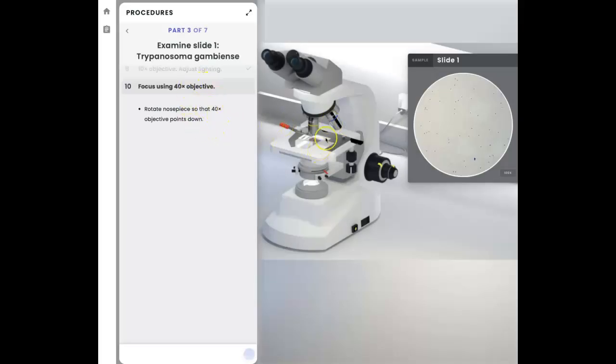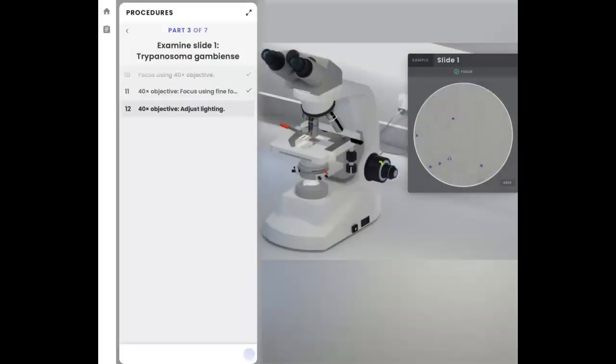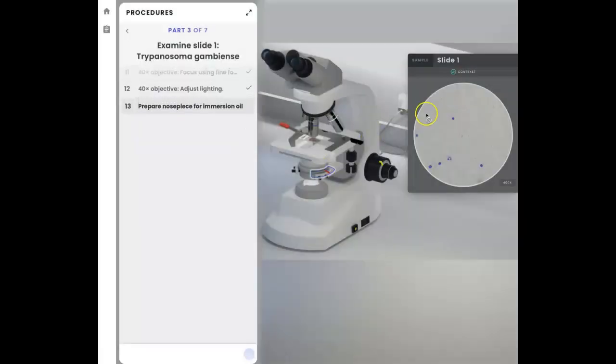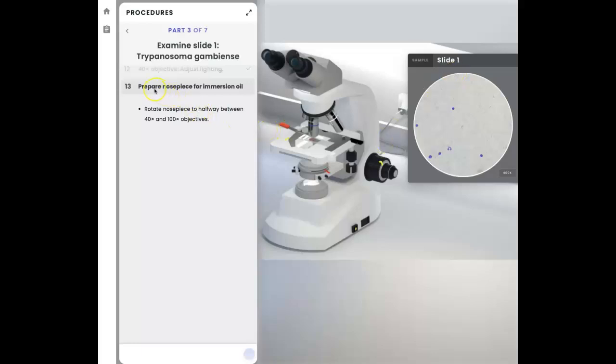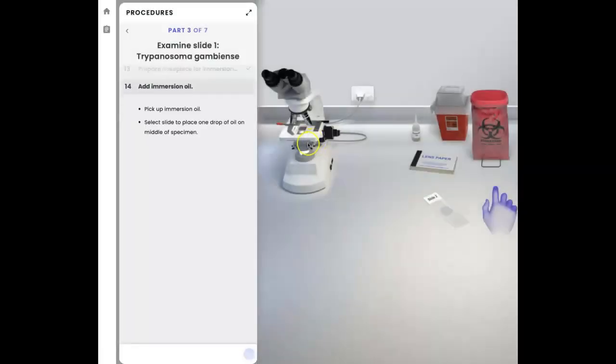Now we proceed with the 40x. So rotate, put in place. Once again, only using the fine focusing knob, we're going to bring this into sharp focus. I can see that that's becoming clear and more clear. There it is. Now we are at 400x magnification. What do they want? They also want more light or less light. So we're enhancing the contrast. There it is. Check mark on the contrast. And now we're going to prepare for the immersion oil. So we're going to rotate the nose piece to the 100x, but not quite to snap it. We're going to leave it halfway as the instructions tell me. Stop right there. See how it's not on the slide?